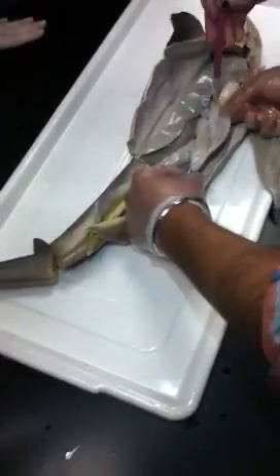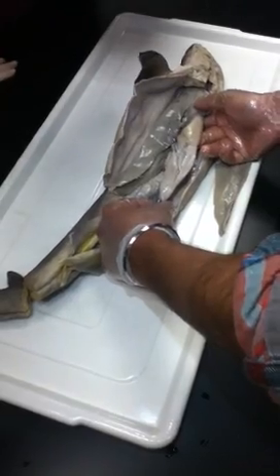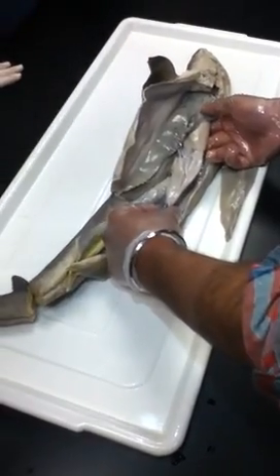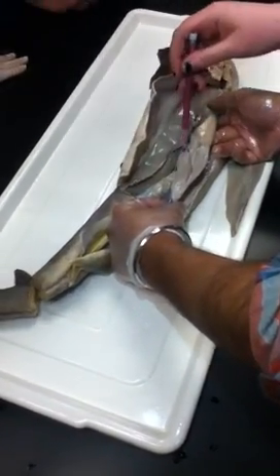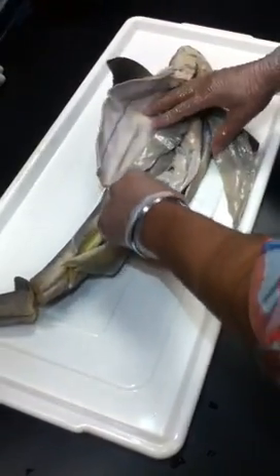It looks like a really skewed J. For the spleen goes up. It's a backward J. Yeah. Oh, I see it. I don't see it. So what was that? The stomach looks like a looping organ over here. Yeah, it's like a hook. Oh, I see it. Okay.